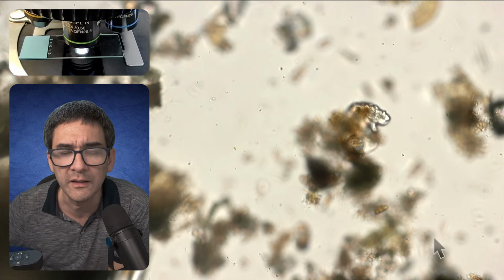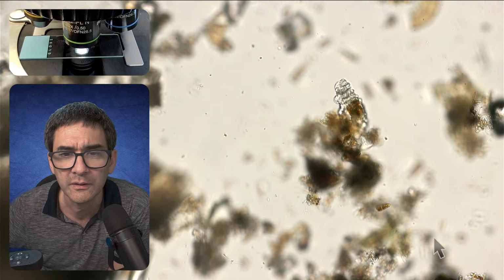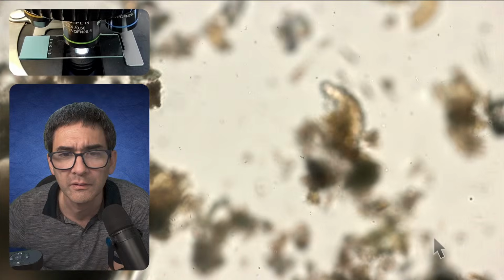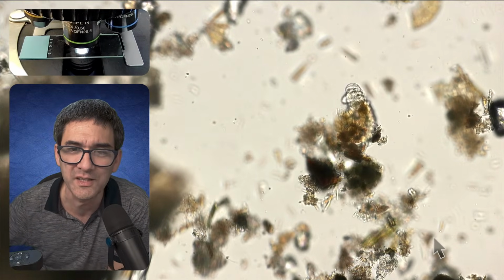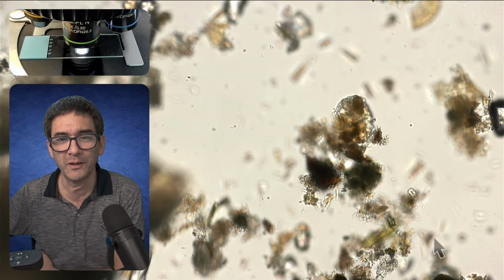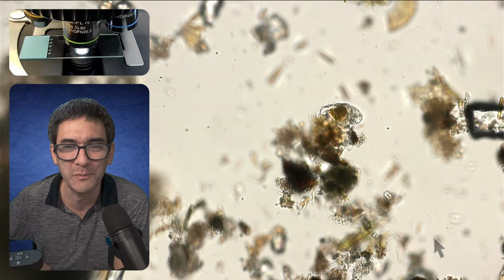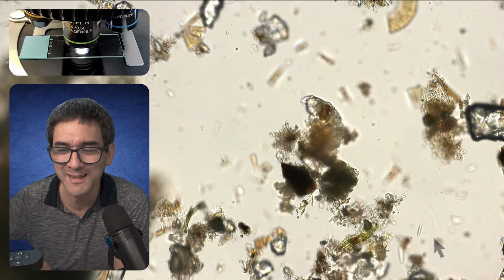Yeah, they like to cling to solid material. Yes, it's a tardigrade. Okay, at least we were successful. That's a little bit for people who are starting off with microscopy, kind of finding a tardigrade, or your first tardigrade. It's almost like a rite of passage, you know.